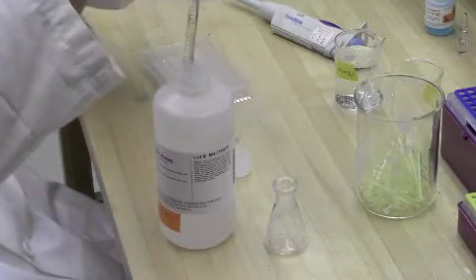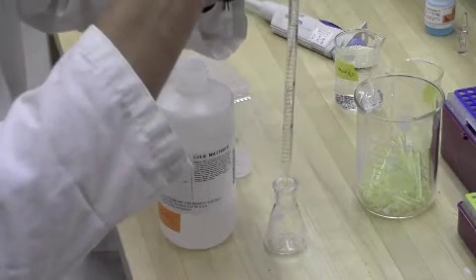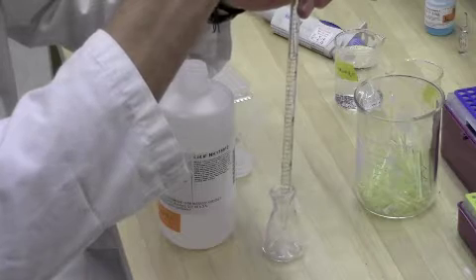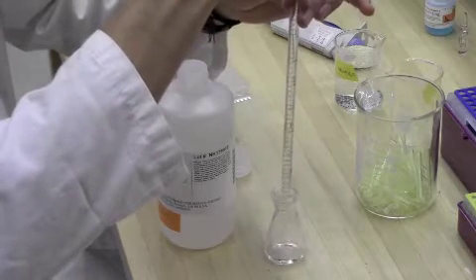After creating all your dilutions, create a 50 to 1 mixture of Reagent A to Reagent B, making sure you make enough volume to add 200 microliters to each reaction well. You should see a color change to light green.